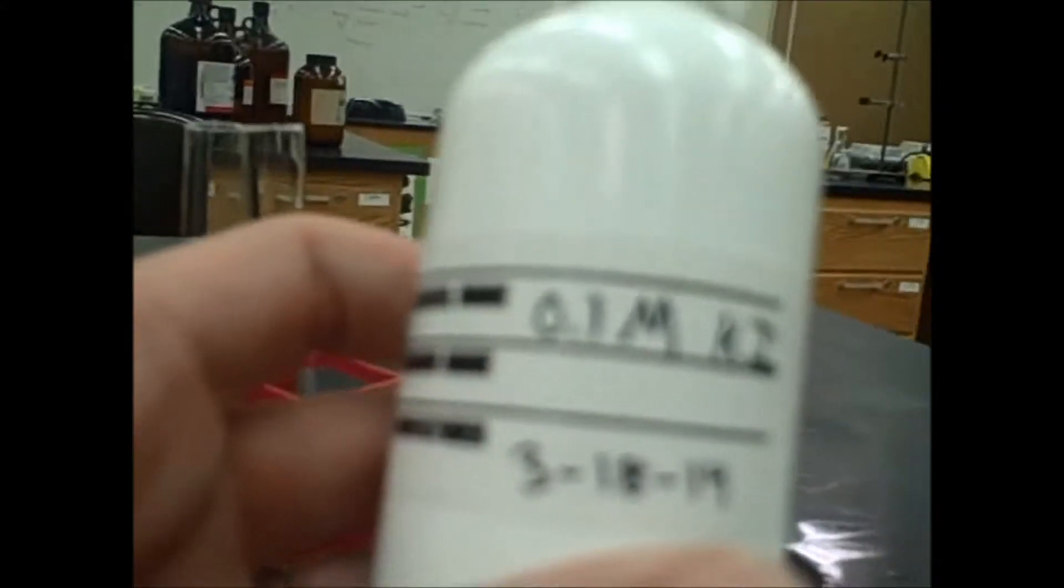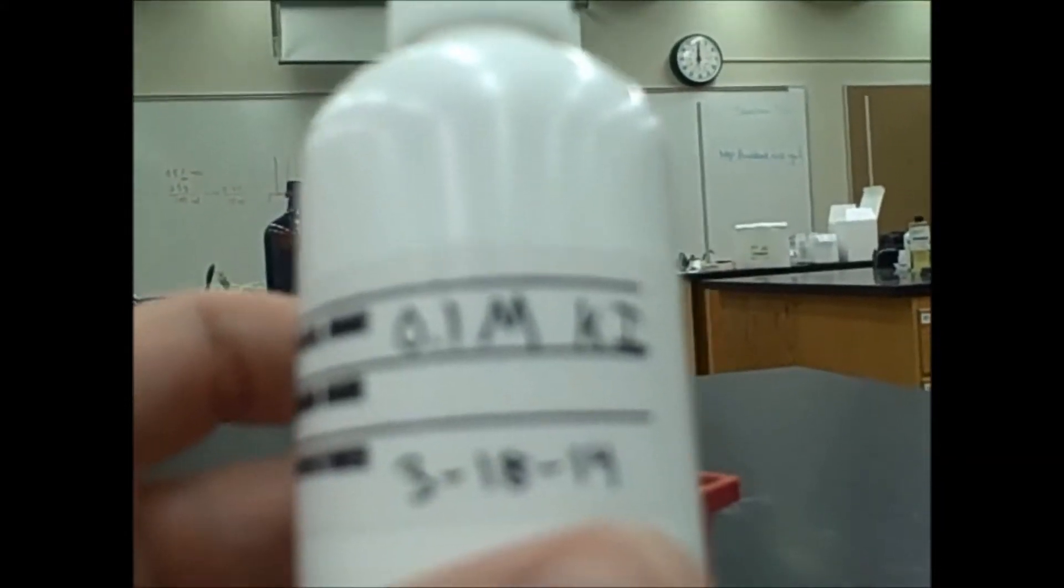And what we want to do is to just look at it. So let's look at what we've got here. I'm going to start off with potassium iodide here.